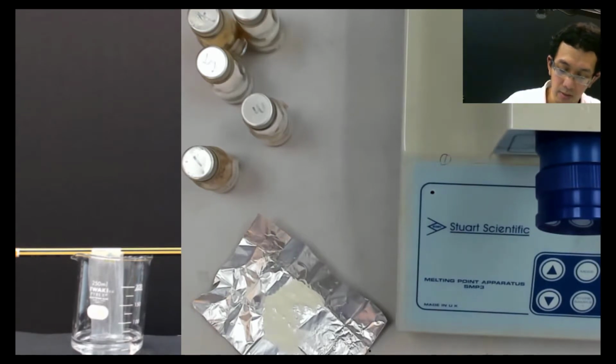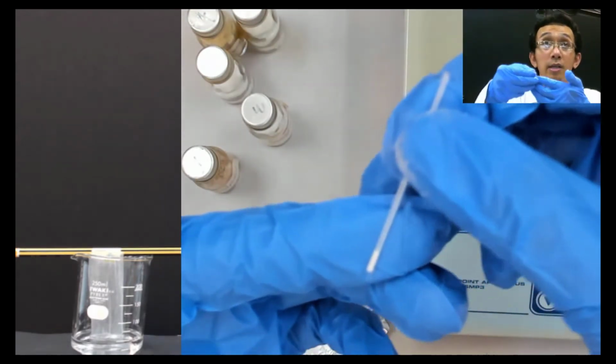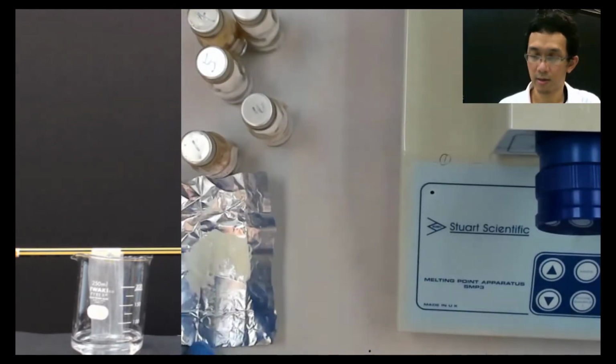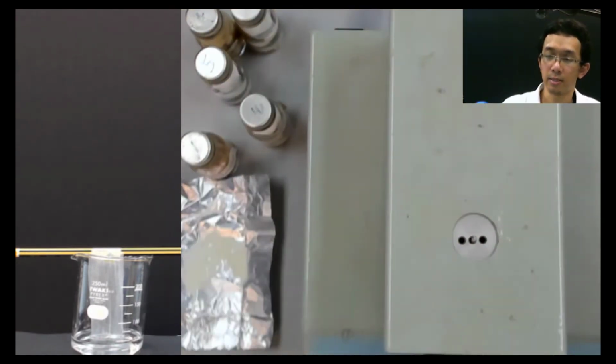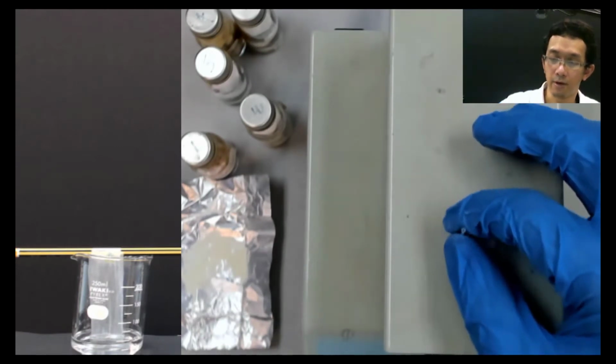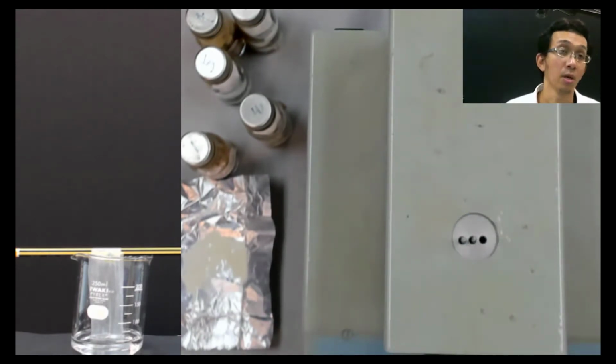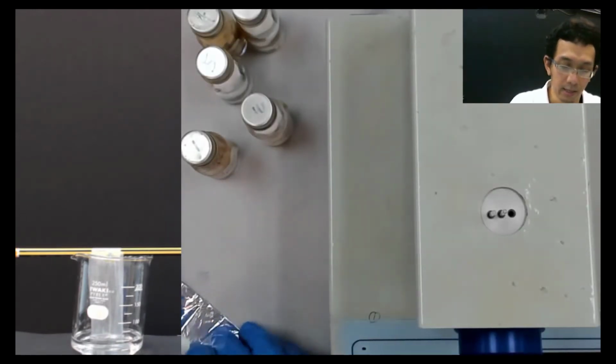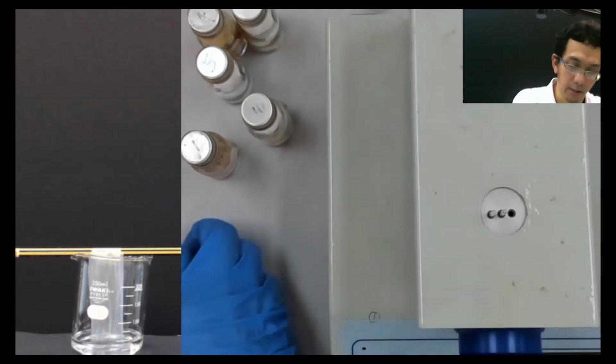Okay, so now there's quite a lot, but it's okay. So you see there is another one. Let me put this on the left. Okay, remember the middle is the X, the left is the Y. Let me clean this table first before I show you.